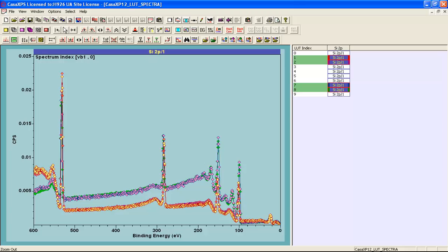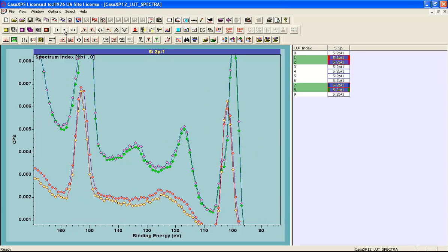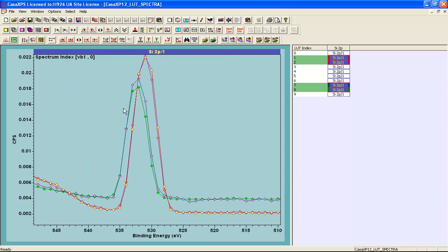Now if we step through this looking at different parts of the spectrum, we can see this is the carbon and the silicon peaks, and you can see that not only is the carbon offset, but some of these other peaks are offset too. Let me just step through some more that I've prepared. This is the oxygen. So you can see the oxygen has a separation which is consistent with the correlation of the oxygen and the carbon images. So here we have two different samples, effectively different film thicknesses of oxide of silicon on silicon, and we find there's a shift in the peaks.